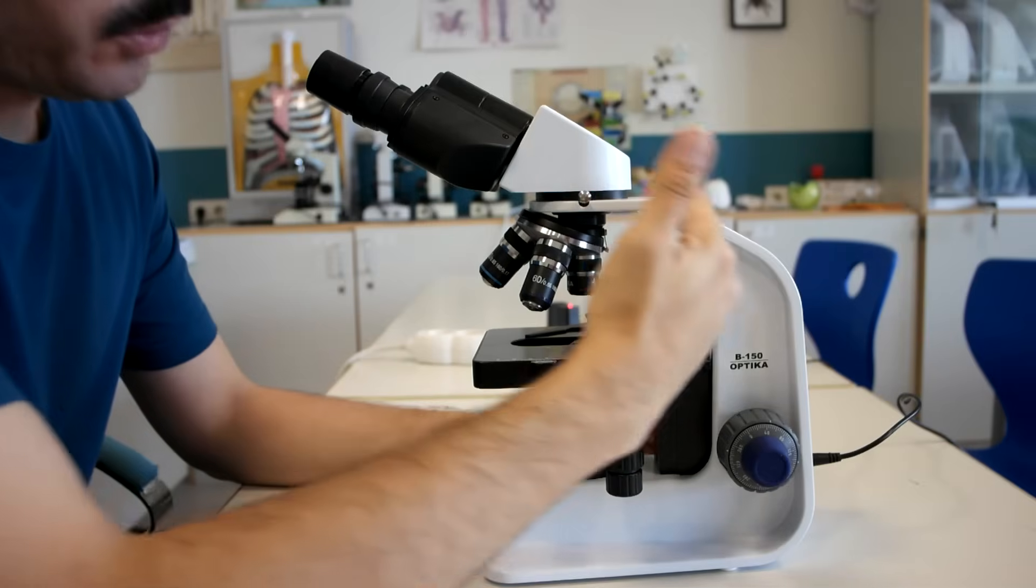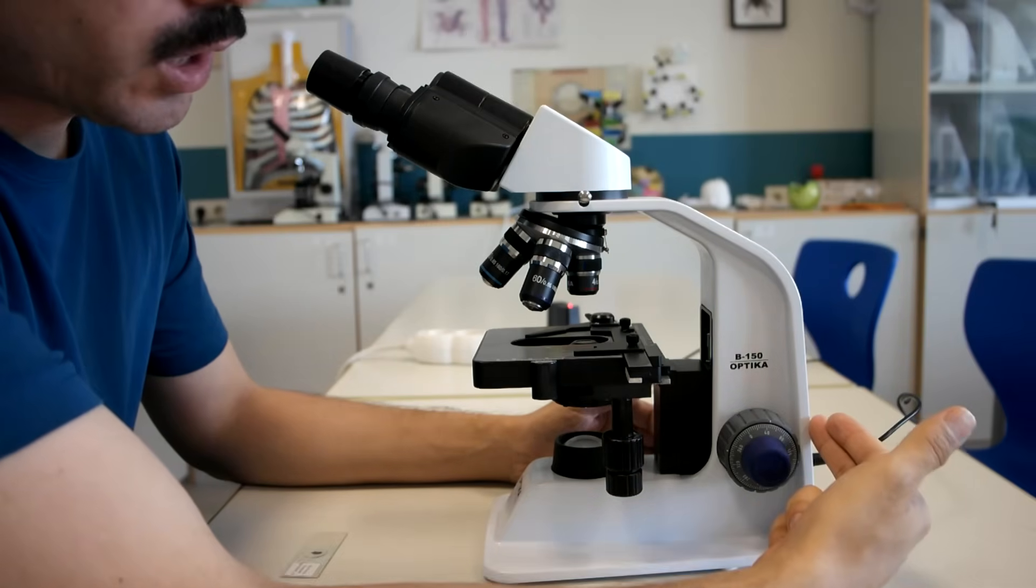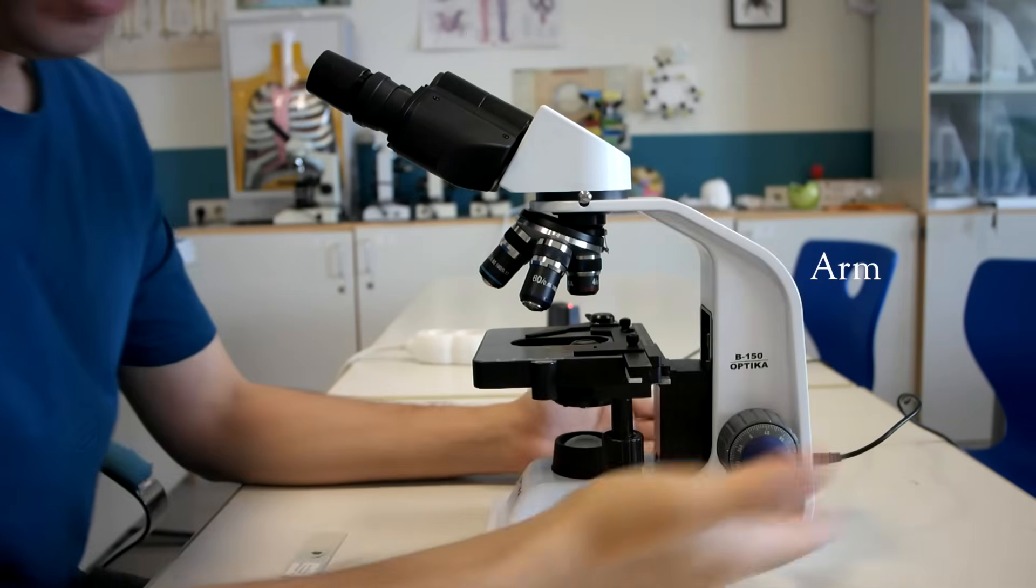So first of all, this part of the light microscope is the arm. We grab from the arm and we support from the base.